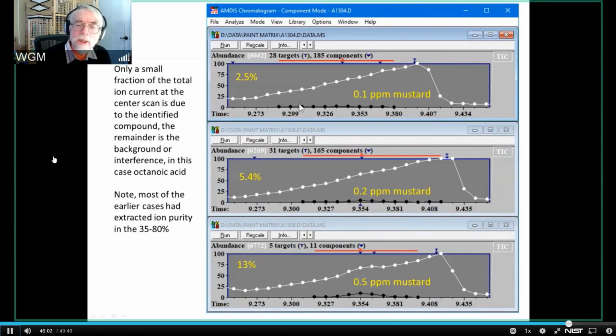And what you see here is the TIC of the mustard. It really is extremely low, and at the peak of the mustard identification, only 2.5% of the ion current is associated with the mustard. And so the other 97.5% of it is associated with this. And so they become very hard things to sort out. But AMDIS is capable of doing that.